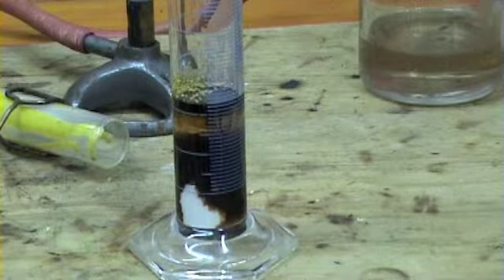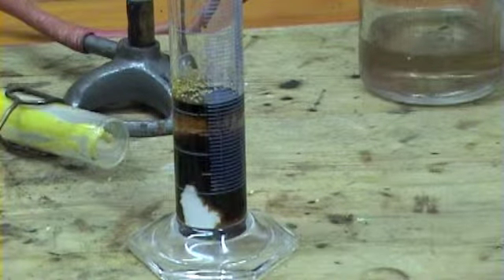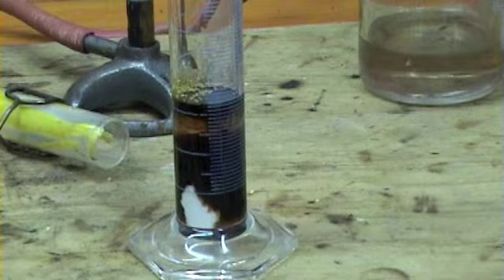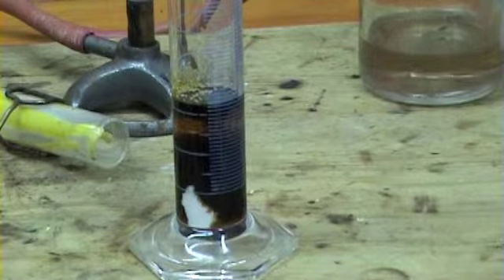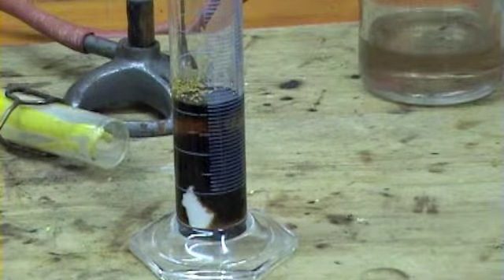Ordinary sulfuric acid is fine because it's aqueous, but for the actual molecular stuff, there's a huge amount of heat released when it reacts with water. If I put that into a beaker and pour water into it, it may spit, because the heat's released all at once. Very exothermic. So when you're making up dilute acids, you always take water and add acid to it, not the other way around.